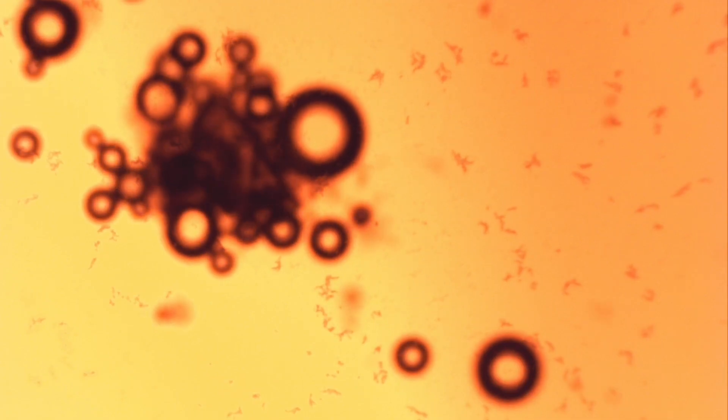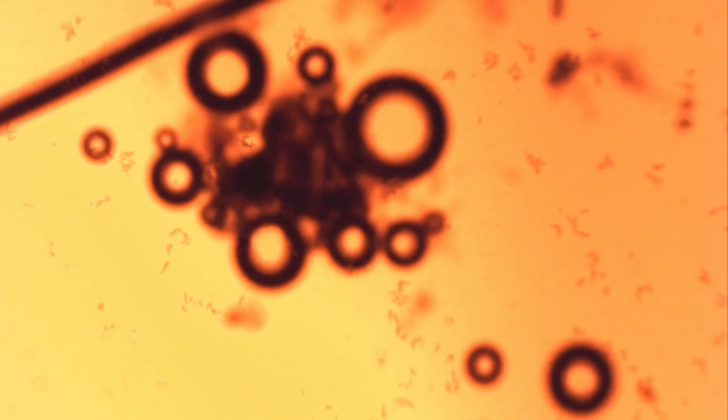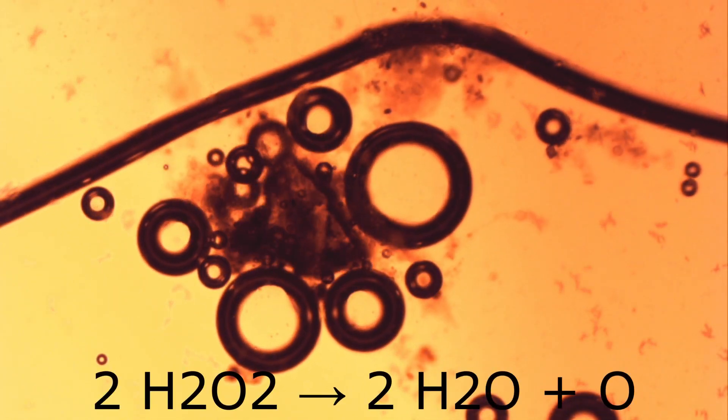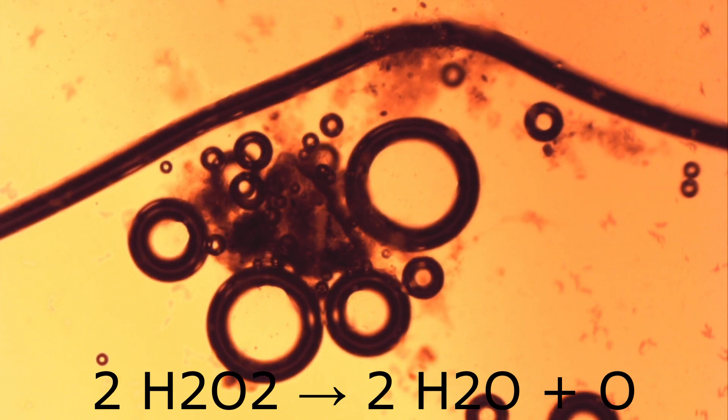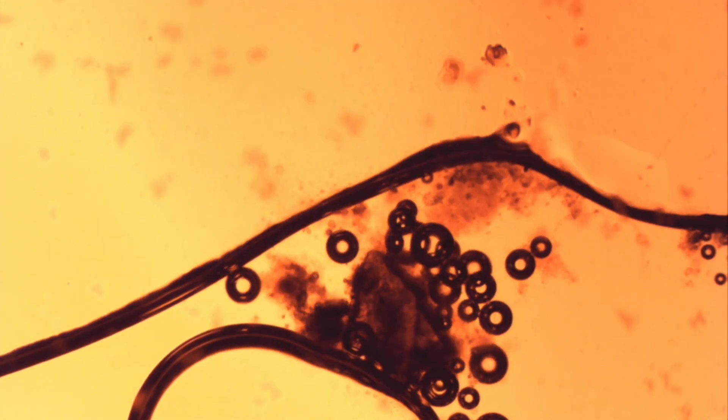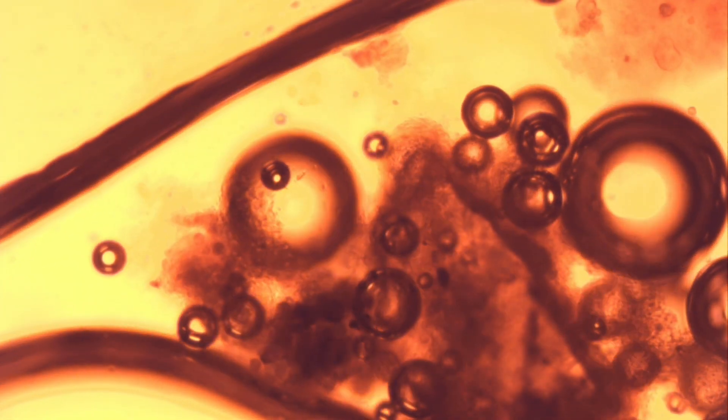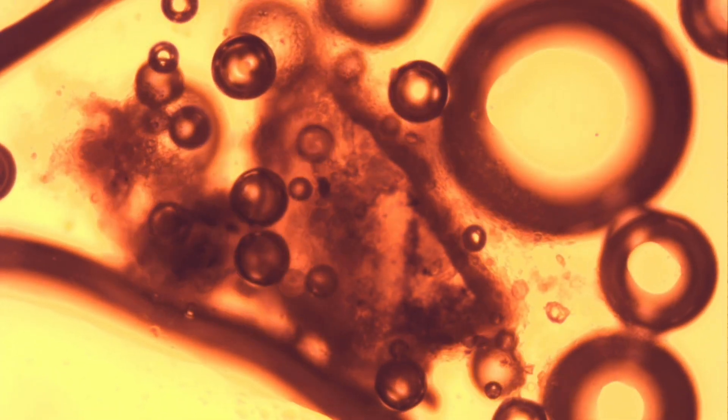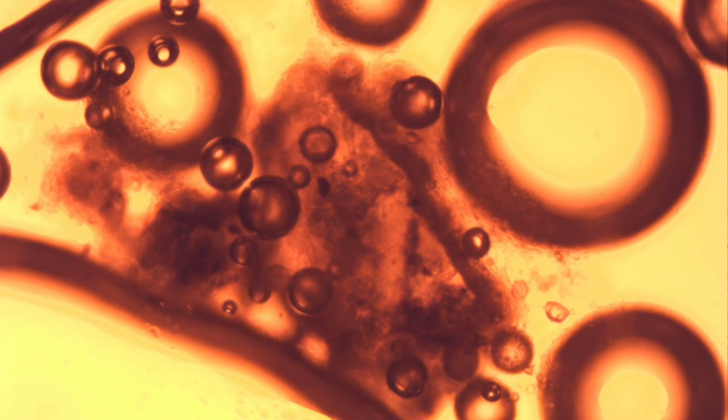I put a cover slip over it so we can see it clearer. All the bubbles are the peroxide decomposing into water and oxygen. The smaller bubbles you see here are very small, almost microscopic in fact, so it looks rather vigorous, but to the naked eye I can only see the largest of the bubbles.